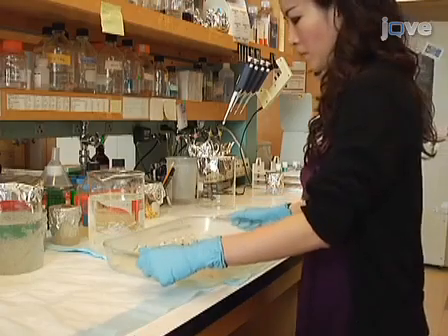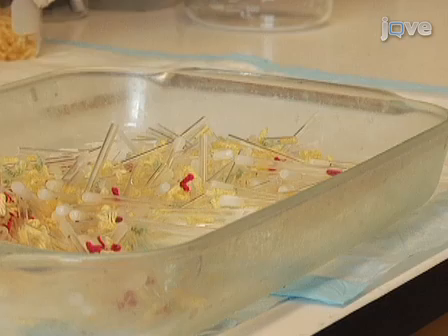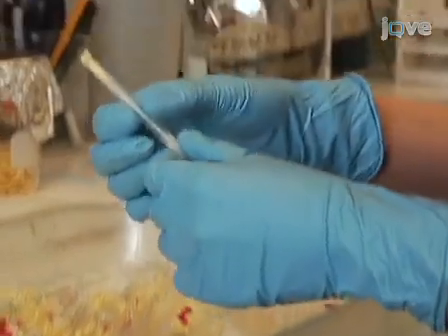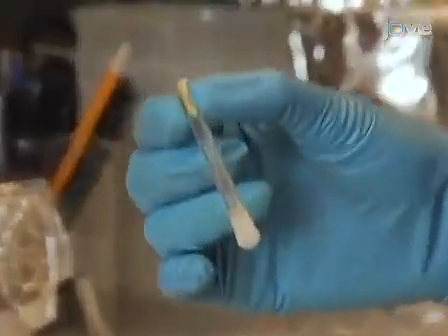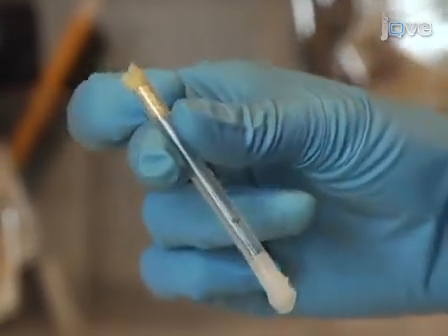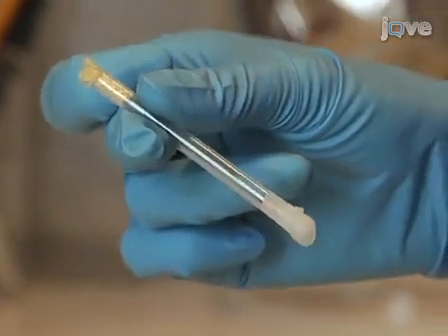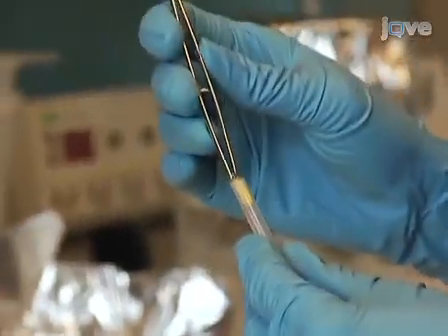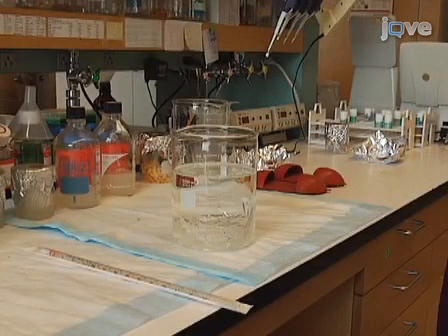Since glass activity tubes can be reused multiple times, the following preparation procedures describe using previously used and unclean activity tubes as the starting point. If you are using new activity tubes, simply skip to the autoclaving of the tubes as shown later. Remove the plugs from used activity tubes and put them into a large glass beaker. The tubes should only fill up to half the beaker. Fill the beaker with tap water, making sure to submerge the tubes.